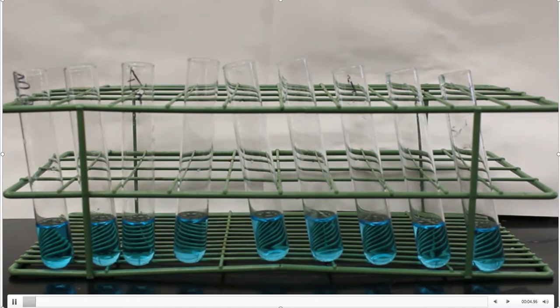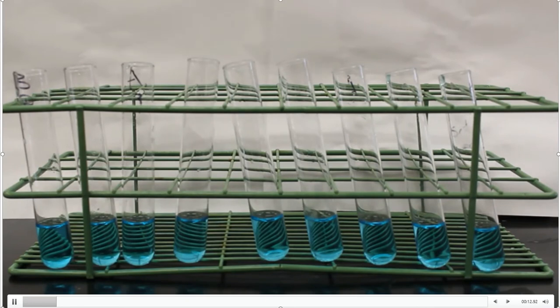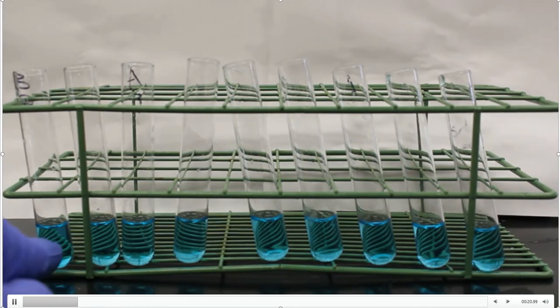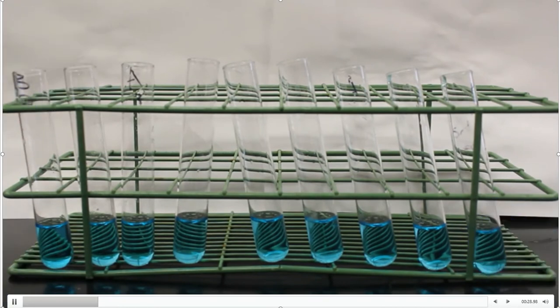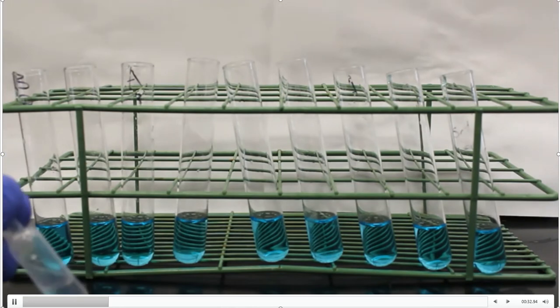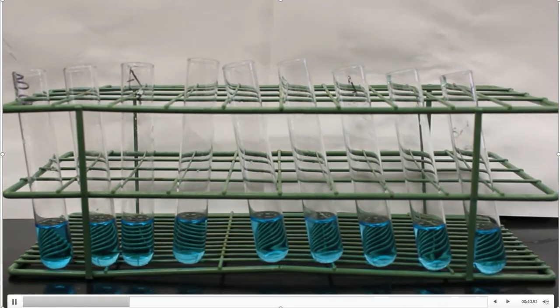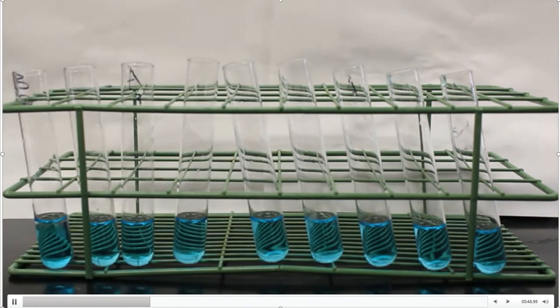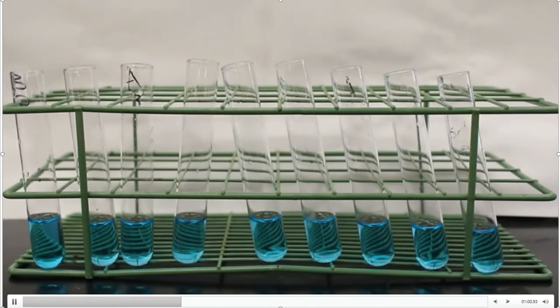So in this qualitative scheme we are doing the Benedict's test, and the Benedict's test is another test that's going to determine the difference between a non-reducing sugar and a reducing one. If you look through your flow chart, you're going to see this is on the disaccharide side. What you see on these test tubes right now is just the Benedict's reagent — a bluish, coppery color. With each one, I'm going to put in 10 drops of sugar solution. There's nothing really major happening as far as observations right now — it's not going to happen until we put it into a hot water bath at 100 degrees.